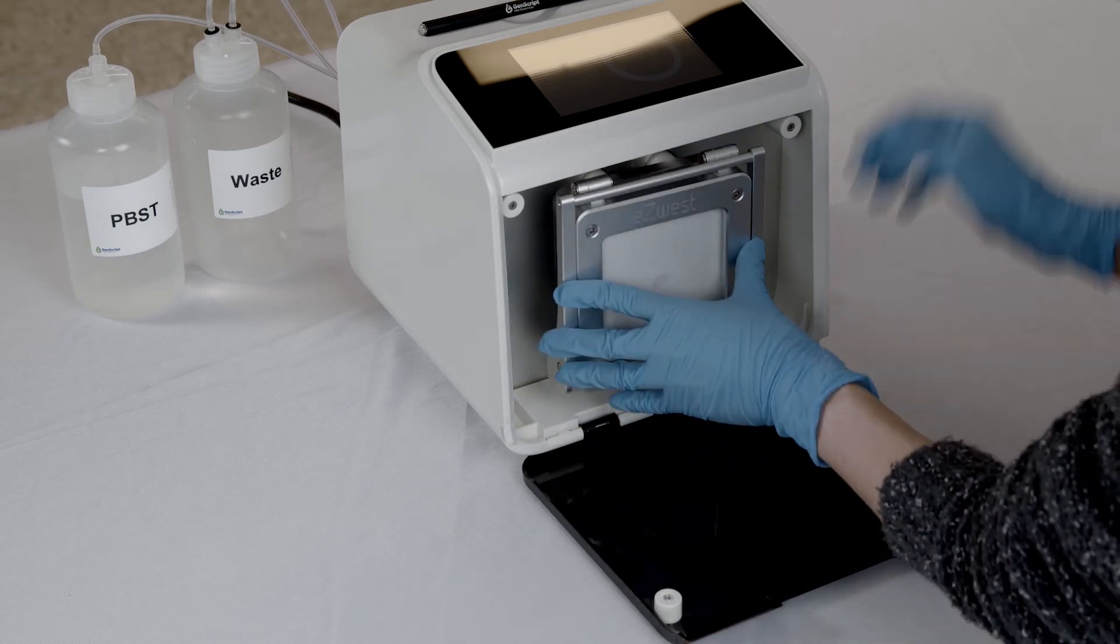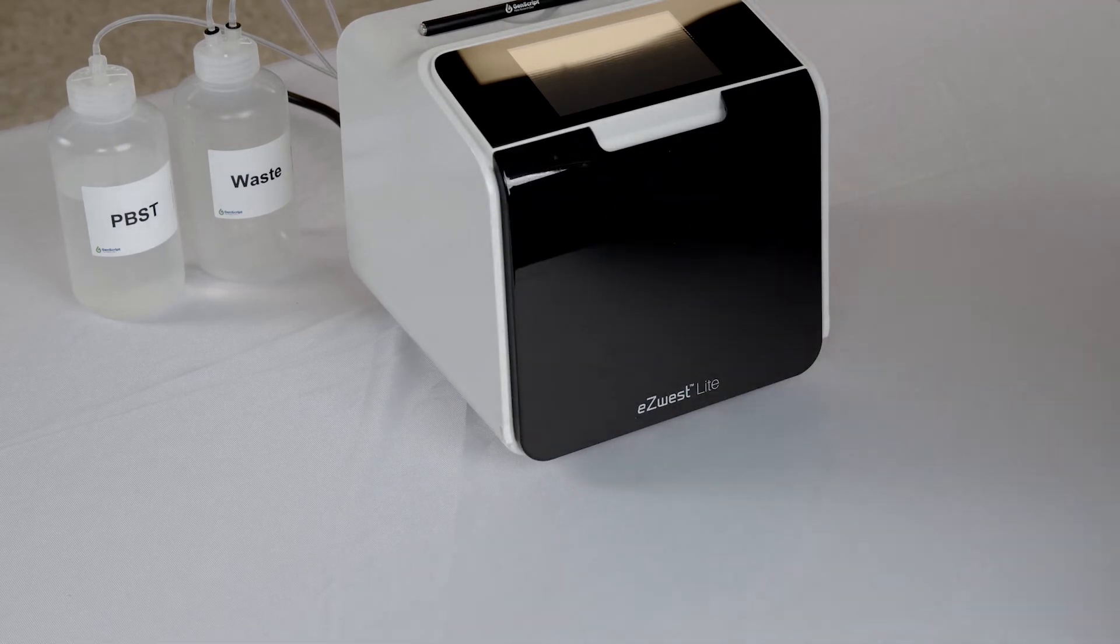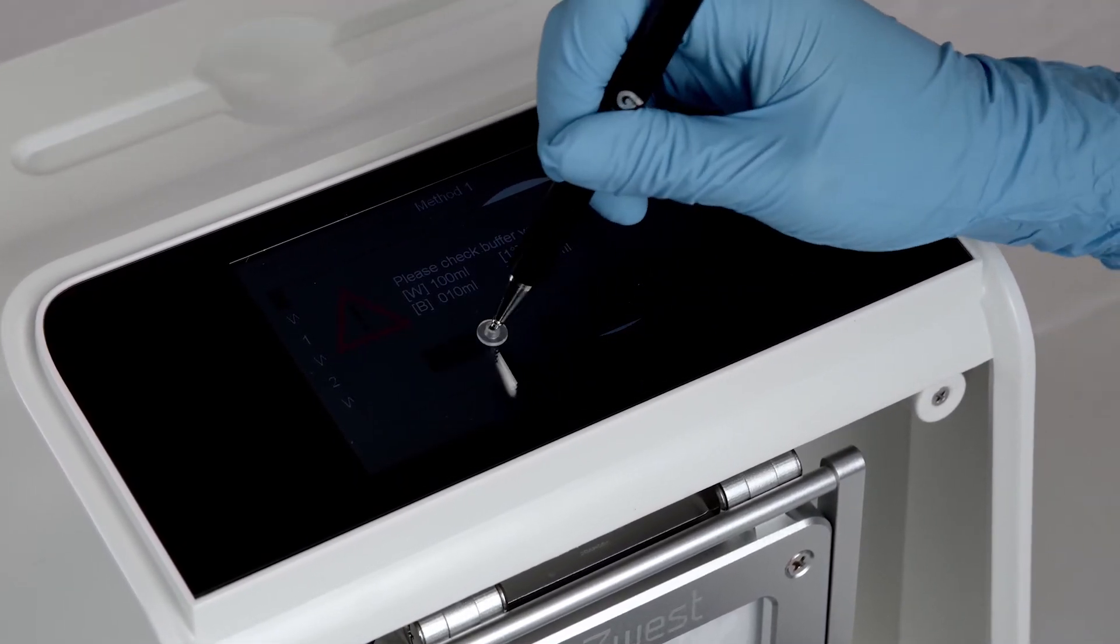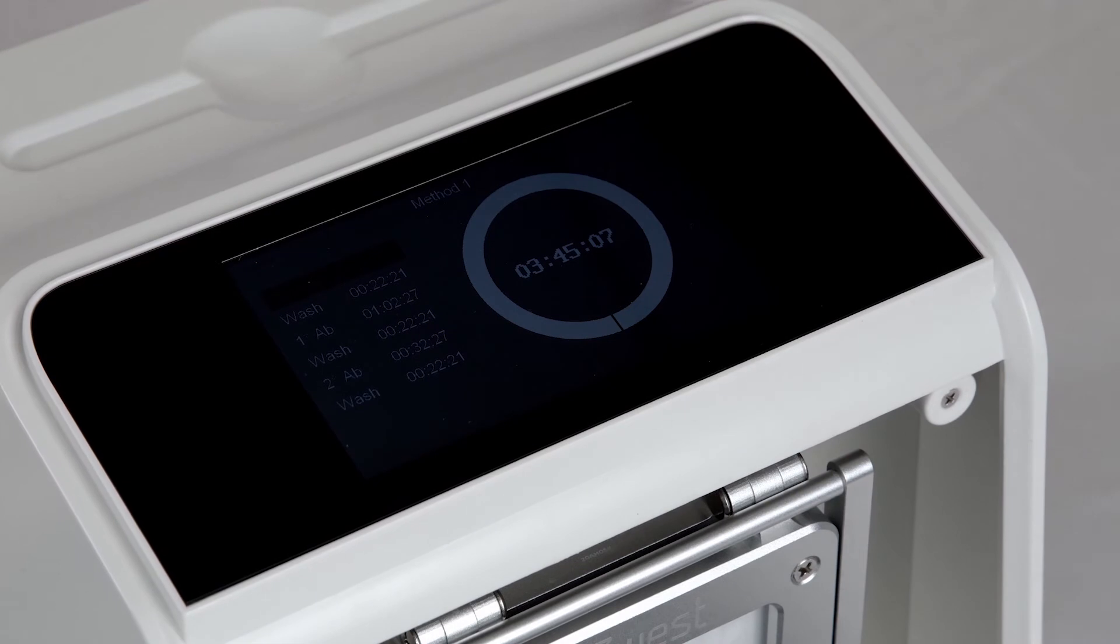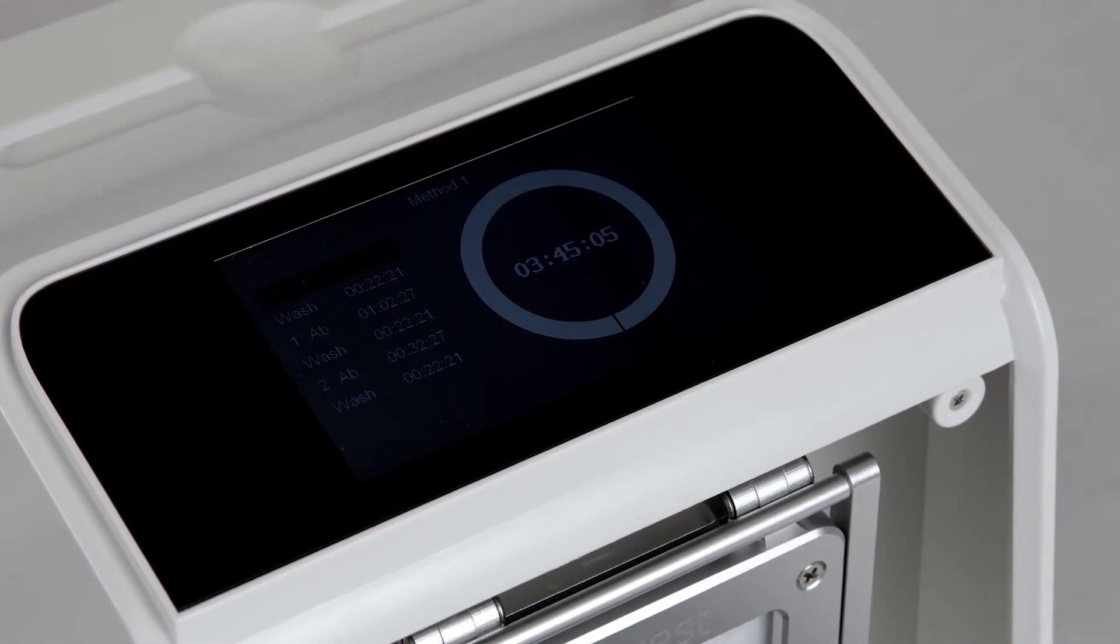Now it's ready to go. Before the program starts, a pop-up message will show up as a reminder to double-check all the reagents and their required volume. Press start, and the instrument will start running.